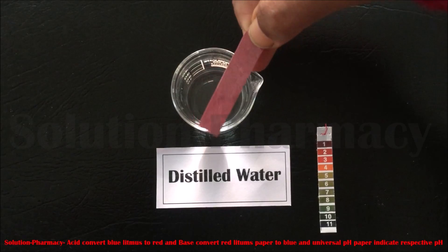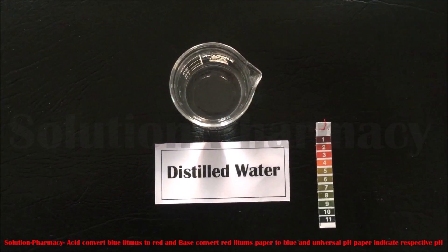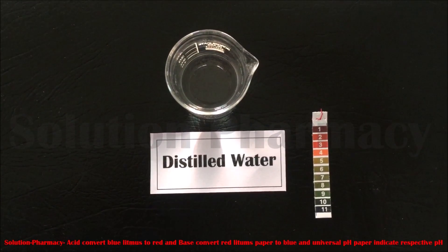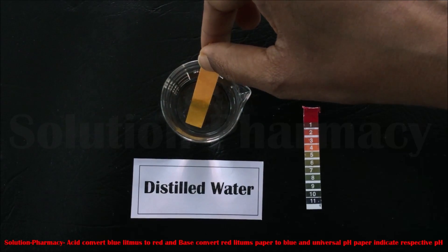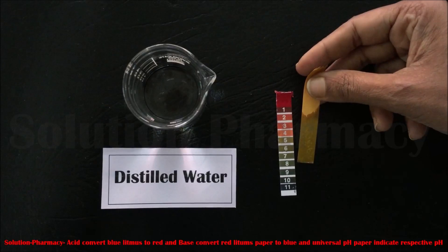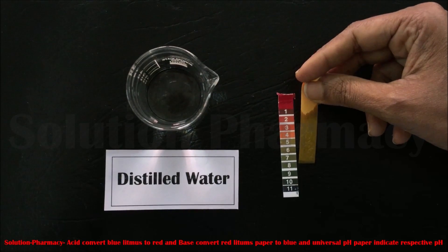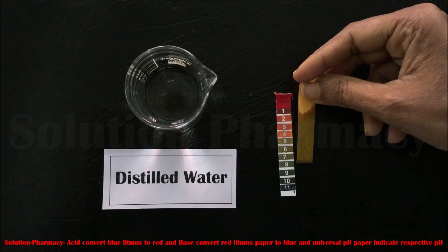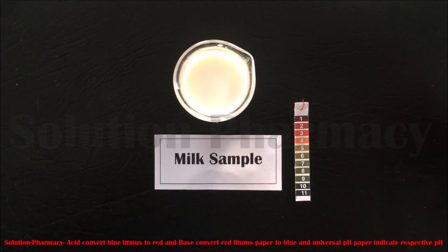Now dip the red litmus paper into distilled water. You can see there is no color change to blue, which means the nature of distilled water is not basic. Now to determine the pH value of distilled water, dip the universal pH paper into it. Remove the pH paper and compare the color developed with the color chart. The color matches the value 7, so the pH of distilled water is 7 — it is neutral in nature.